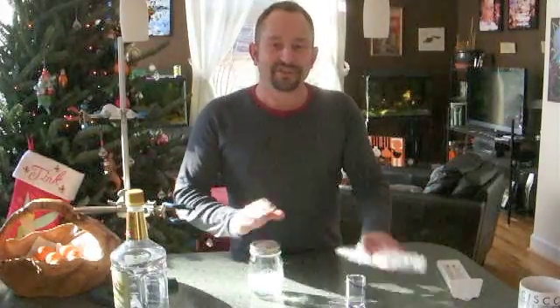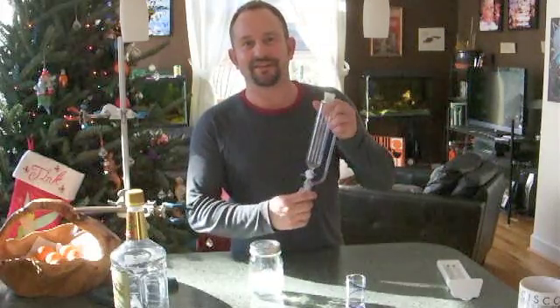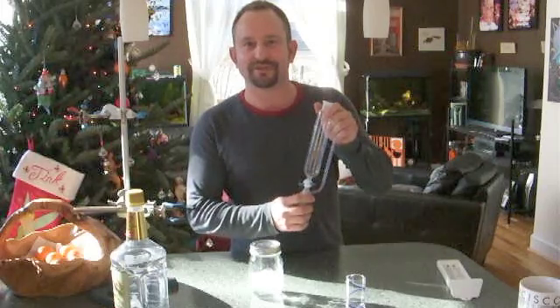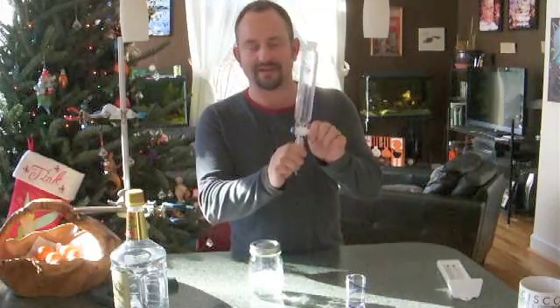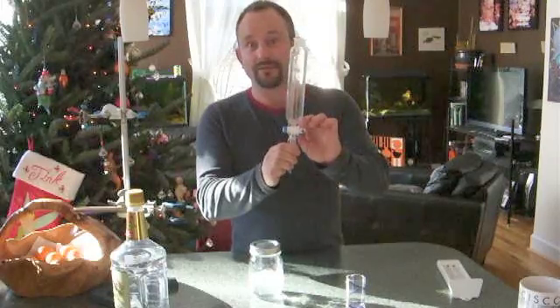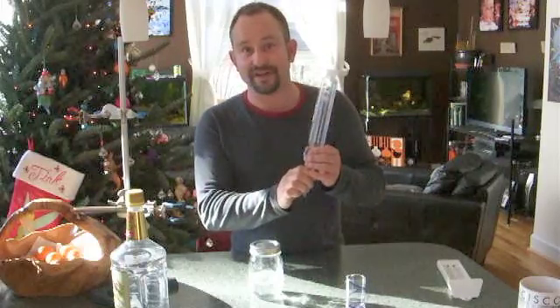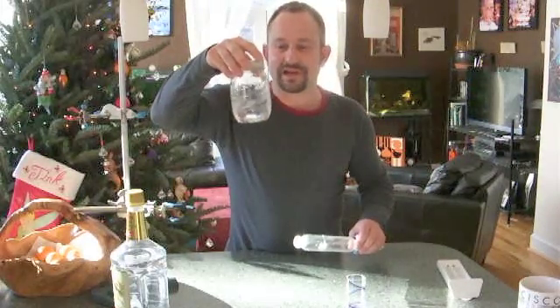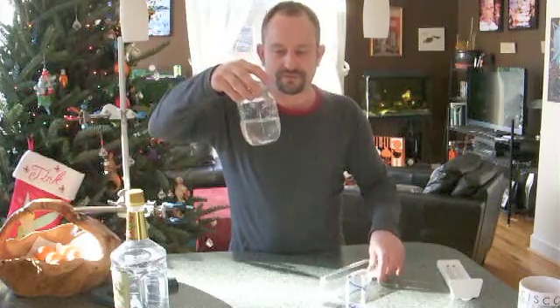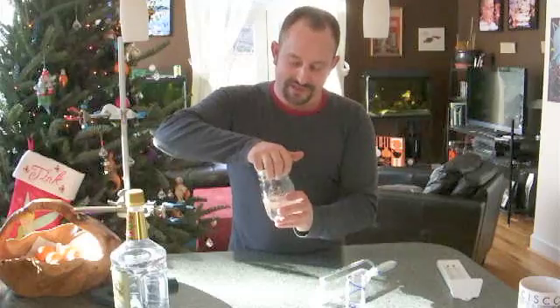There you have it. I think that in retrospect I was probably a little bit impatient — given the time to do it again, I think I would have drained off the hydrosol through this tap here and actually separated out the few droplets of pure geranium oil that were in there and kept those to one side. However, I did choose to solubilize the lot and here it is. This smells wonderfully like geraniums which, frankly, always remind me of my grandmothers. Both my grandmothers liked geraniums.